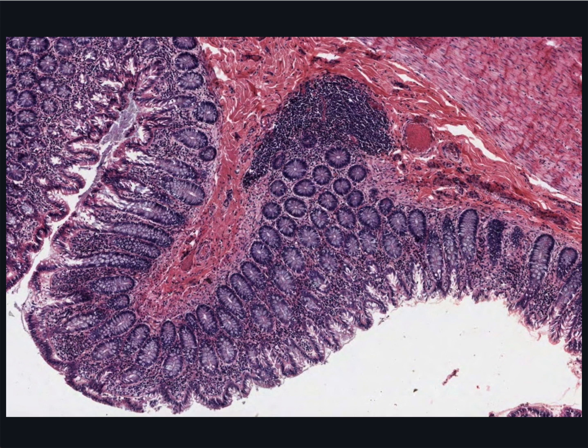As well as this diffuse lymphatic tissue, there are lymphatic nodules which are aggregations of lymphocytes contained within a meshwork of reticular cells and reticular fibres. You can see one of these lymph nodules or lymph follicles here. They're very distinct, aren't they? But they're not encapsulated. We would call this a primary nodule, as it's just a collection of small lymphocytes.